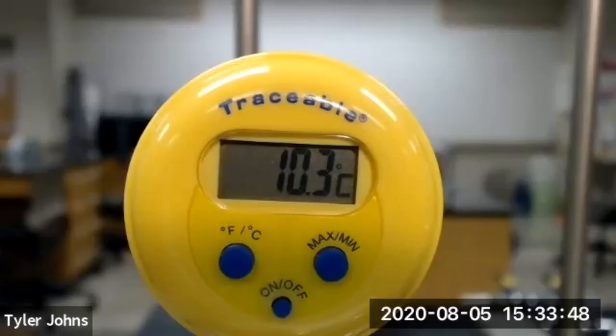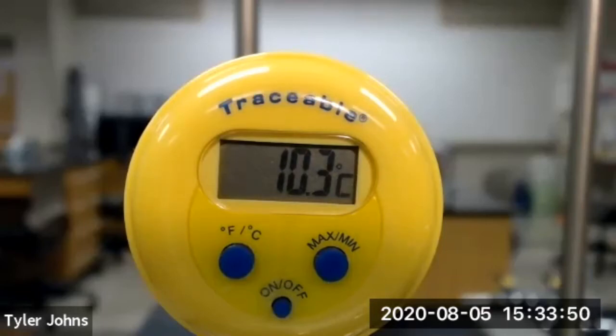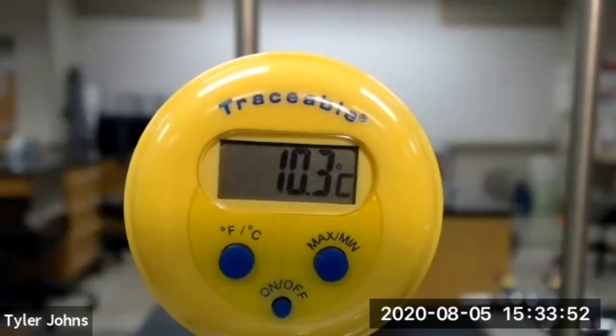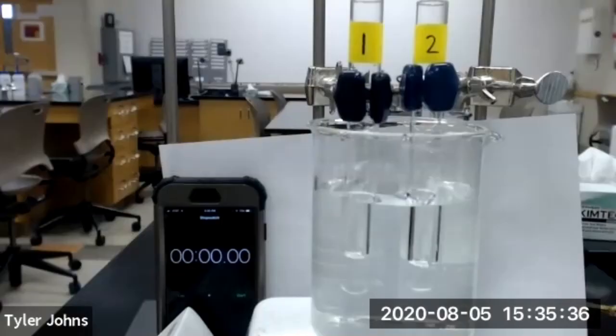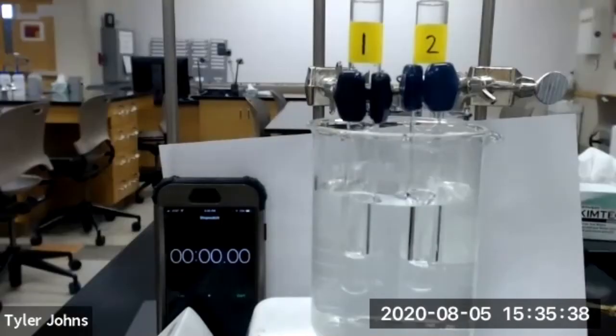The initial temperature for trial number three is 10.3 degrees Celsius. We'll now start trial three of part B.